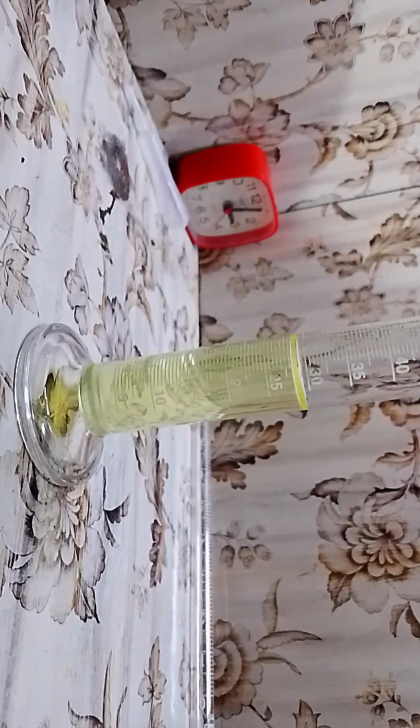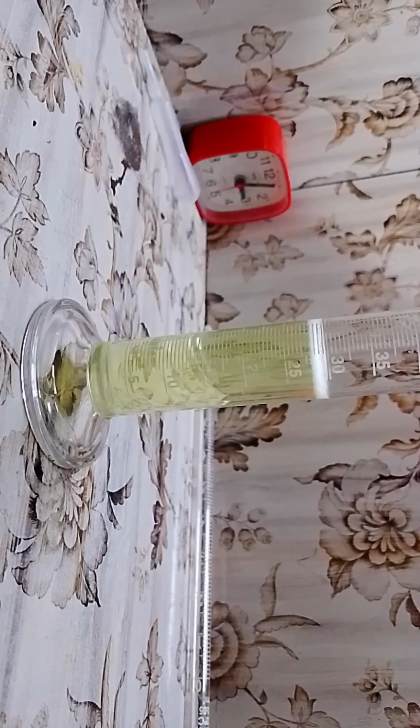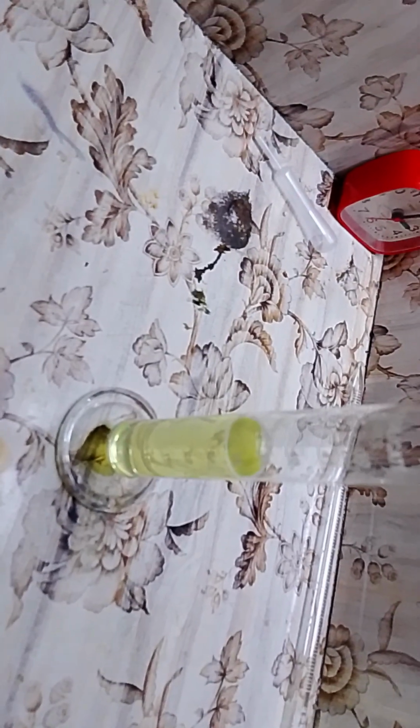Okay, so the first test we are going to do is the very common base test. Any carbonate or sulfide salt can be added. I'm adding a little bit of sodium carbonate. Look at the solution below. I'll ask my cameraman to focus on the solution below. I'll add the basic sodium carbonate and it will show effervescence immediately. That's the evolution of carbon dioxide. Great. So the first test for acid has been confirmed, that this is an acid. Totally all of it has dissolved.